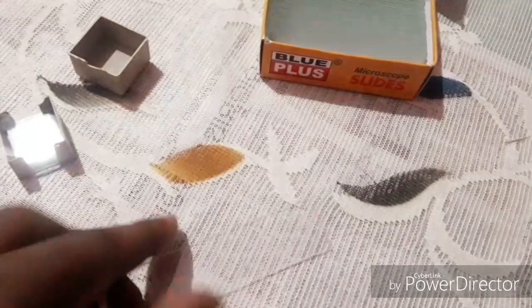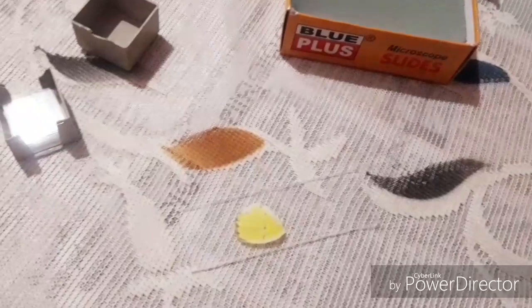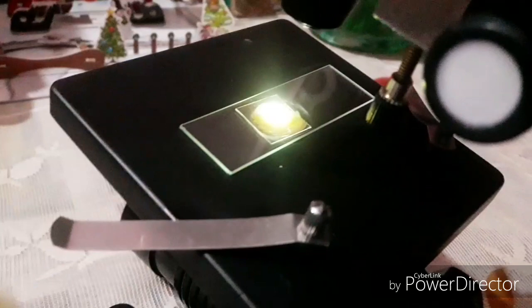Now it's time to mount a specimen. For that, you only have to take a glass slide and with the help of forceps gently take your sample and place it on the center of the glass slide, just like this. Then gently place a cover slip on the top of your specimen. You should be very careful while placing the cover slip so that you don't damage the specimen. Now it is time for staging the mount onto the microscope — just place the slide under the objective lens and secure it with the help of the clips. Now it's time for observation.